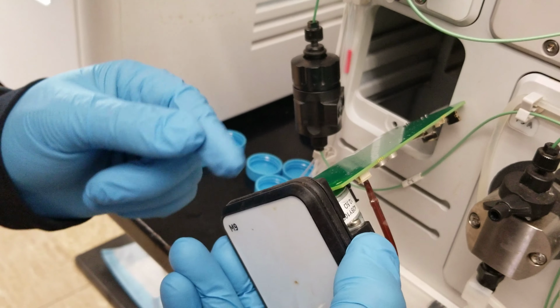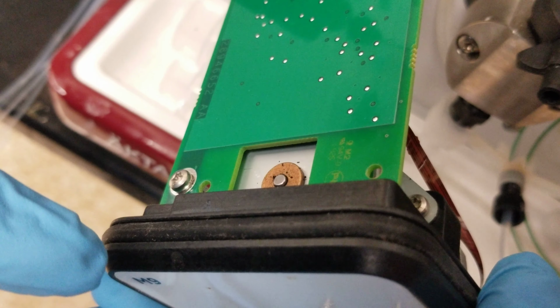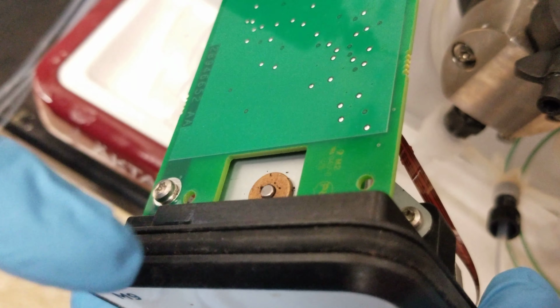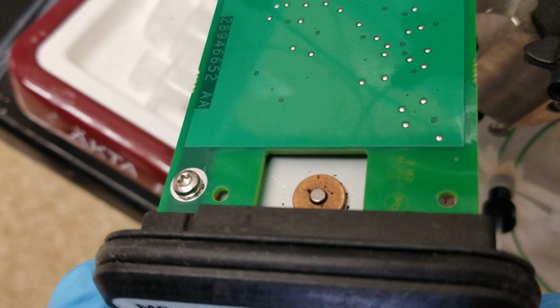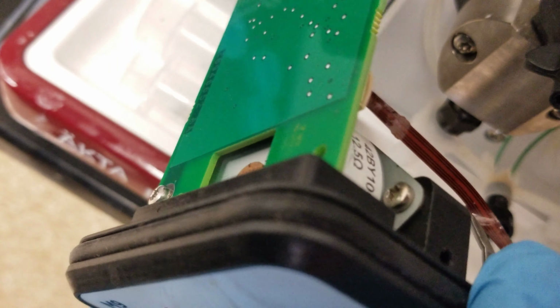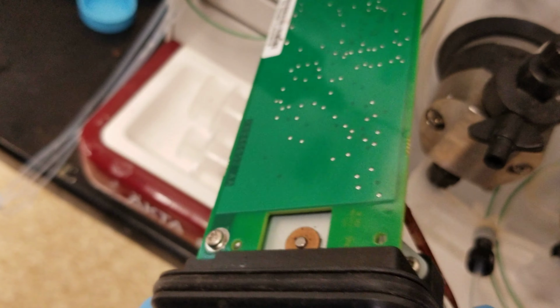Okay. What do you see? This side is not attached. Why is it not attached? Is that normal? Wait a second. Maybe it's not supposed to be. See? There's no screw on this side. How's the other side attached? Other side has a screw that goes all the way down from the top. Supposed to be a screw here?